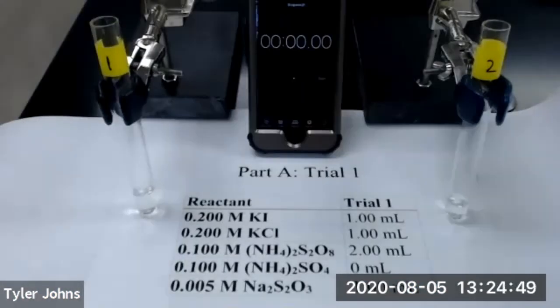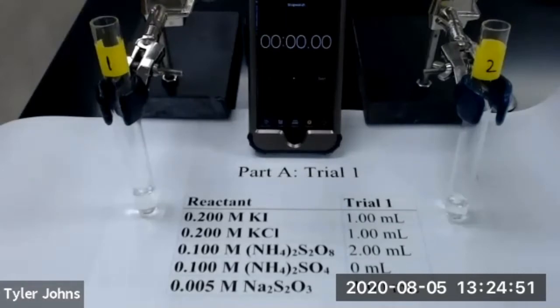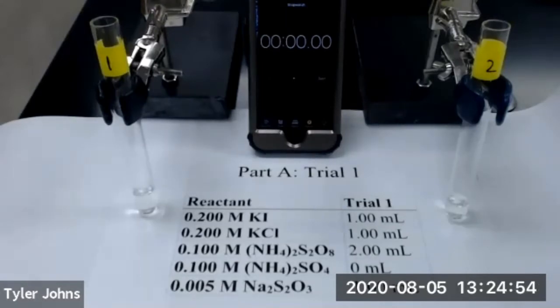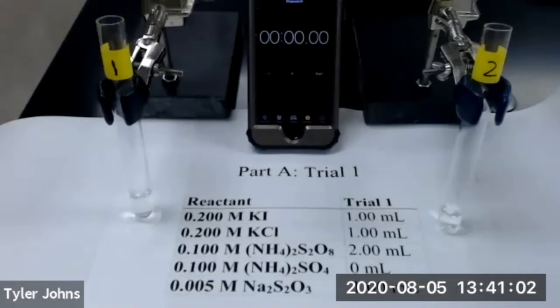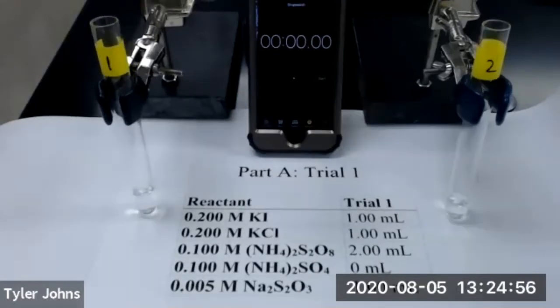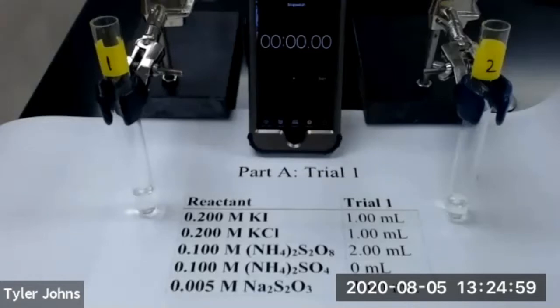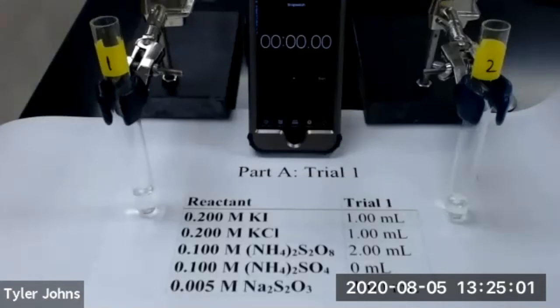We will now add 2 drops of 1% starch indicator to test tube number one. We will now start our reaction for trial number one by transferring the contents of test tube number two to test tube number one and quickly mixing. As soon as we make that transfer, we will start a timer, and we will stop our timer as soon as the solution turns blue.